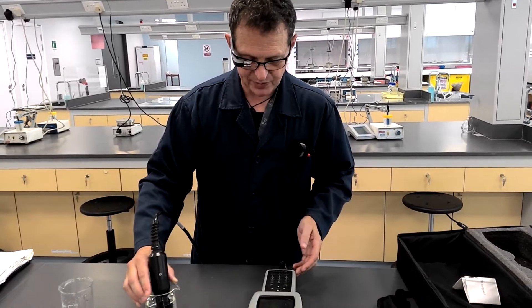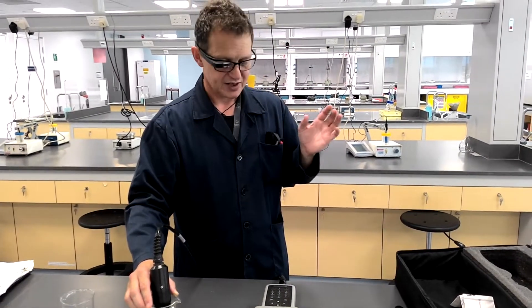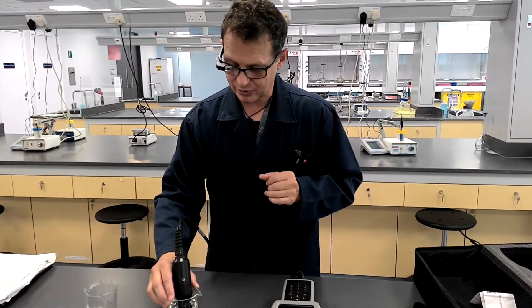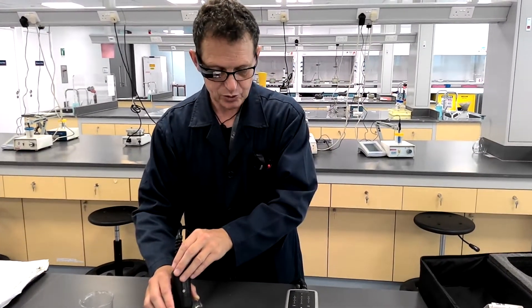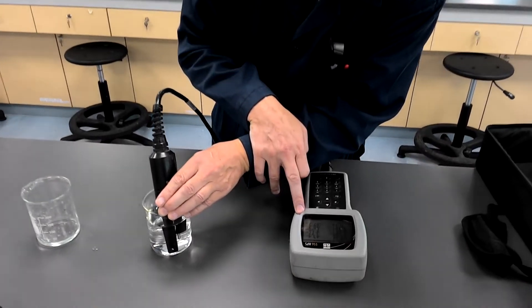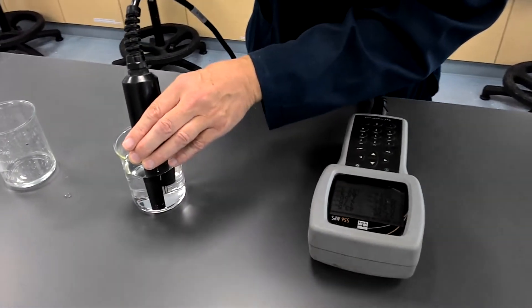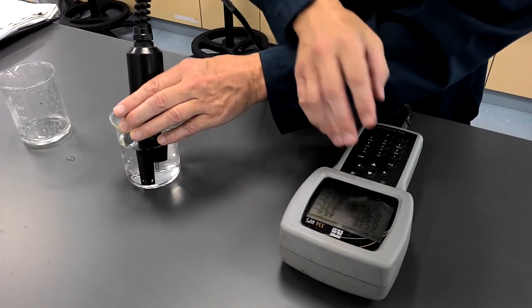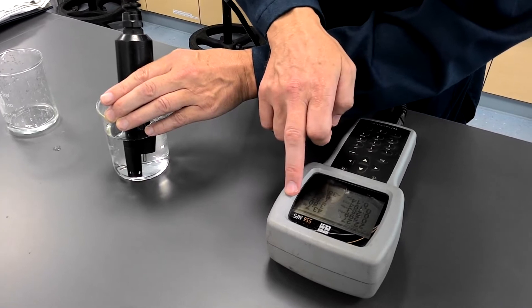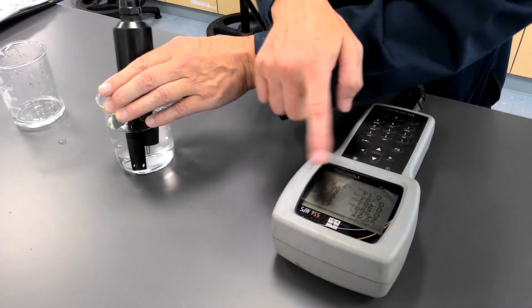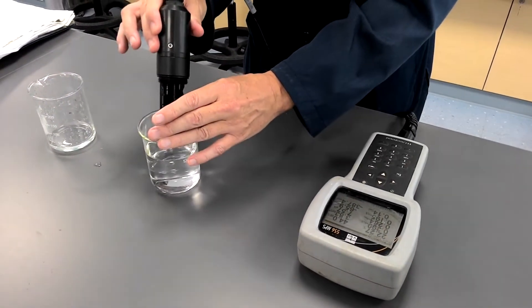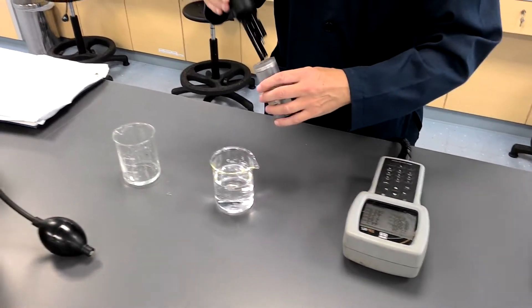This is simply water which has been in the pipes all day. If we were to run the tap a little bit and then redo the measurement, in fact we probably could do that, we will find that changed. Anyway, I will meanwhile, we have a variety of measurements here. I won't bore you because all the meters are different. We've got the saturation. We've got the percent dissolved oxygen. We've got the temperature and various other components there. And the pH 7.57. I'm going to take this out for a moment and replace it here.